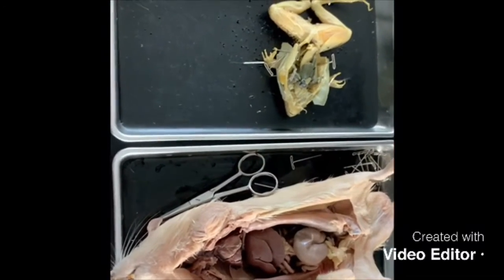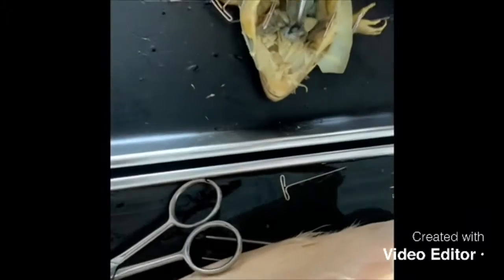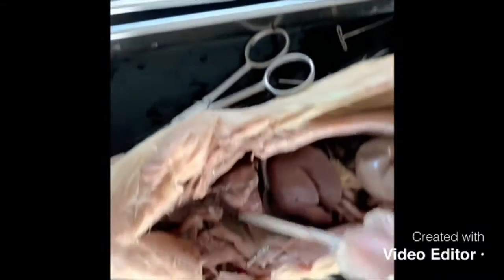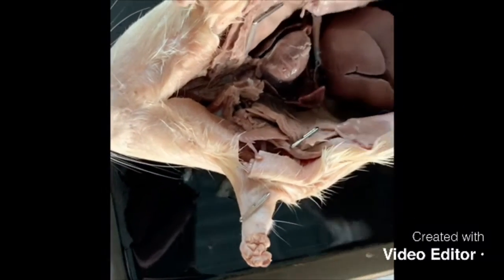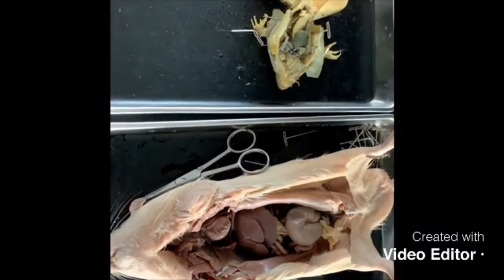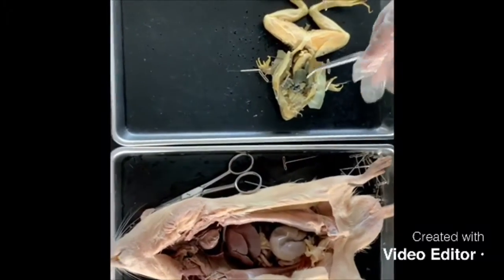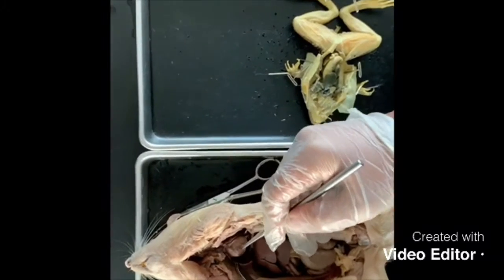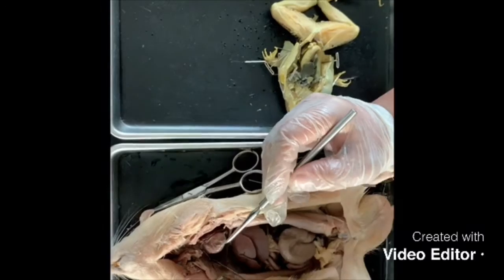To identify parts of the circulatory system between both animals, the frog's heart here is smaller than the heart of a rat because the rat needs to produce more blood since it's a larger organism. A frog's heart only has 3 chambers, 2 atria, which we cannot see, and 1 ventricle, which mixes oxygen-rich and oxygen-poor blood. While the rat's heart is more specialized in its function, as it contains 2 atria and 2 ventricles like the human heart.